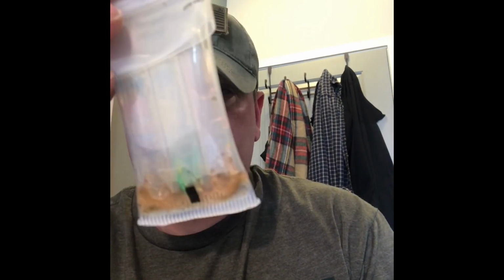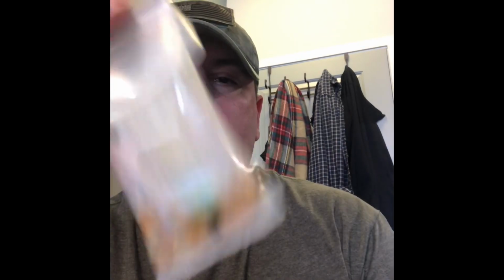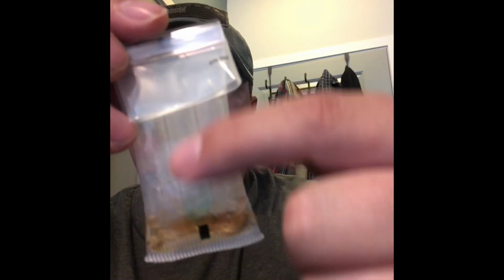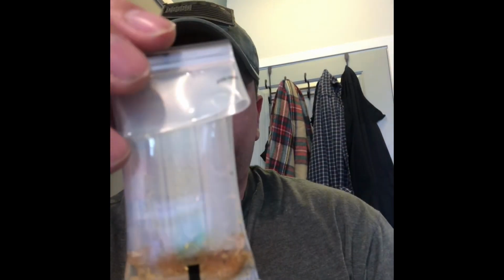And it's losing that tint too, so that's going away. You see it blue up here because this had turned blue automatically, so you have that blue that's on the glass that's still broken in there. Would you call that a positive? Because I wouldn't.